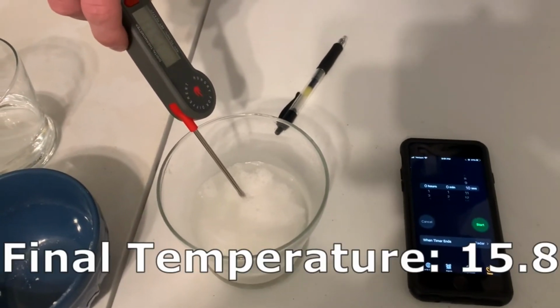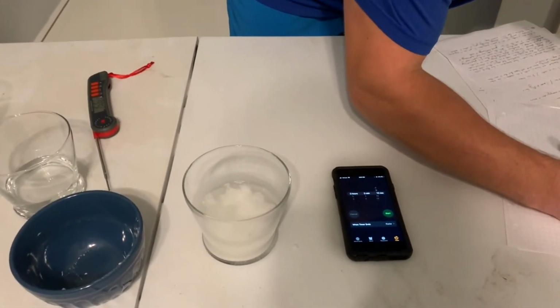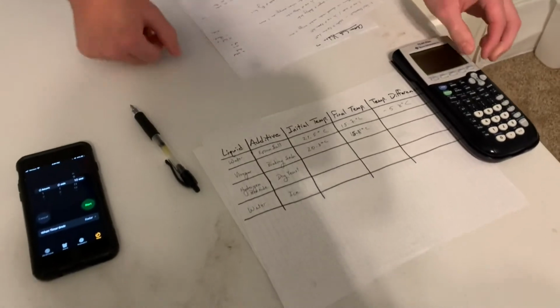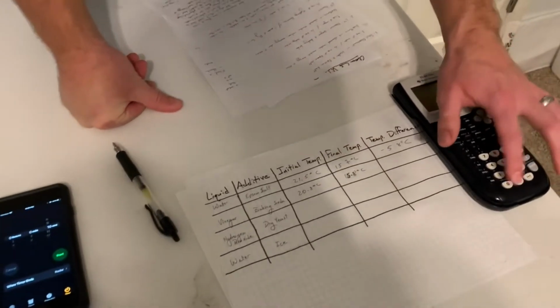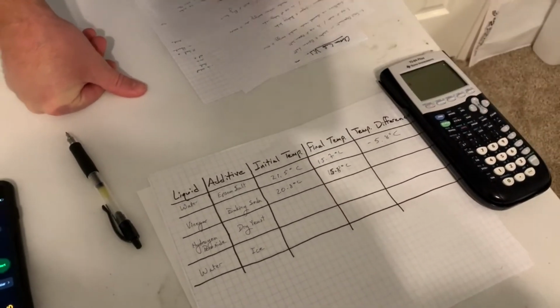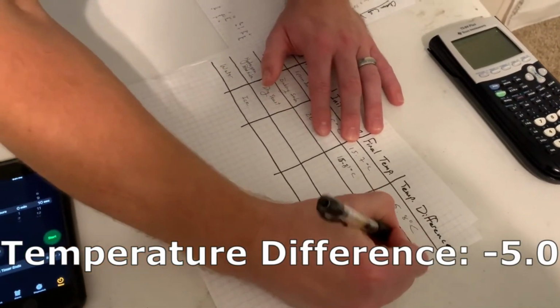All right, 15.8 degrees Celsius. Okay, there we go. So now we'll use our calculator and we'll take our final temperature of 15.8 degrees minus 20.8, which gives us a temperature of -5 degrees Celsius. So that means that it's endothermic. So what that means is that in order for this reaction to occur, it had to absorb heat and absorb energy for it to happen. And that's why the vinegar got colder after the reaction happened.